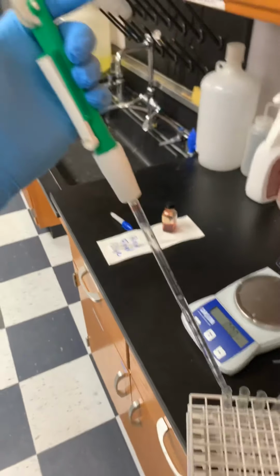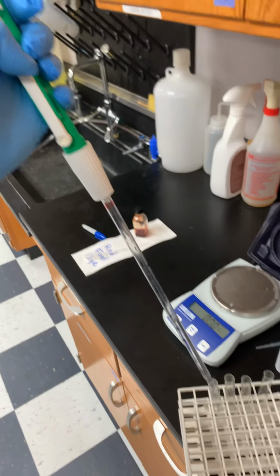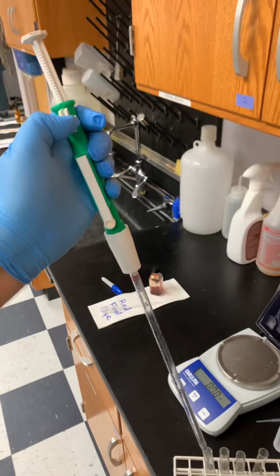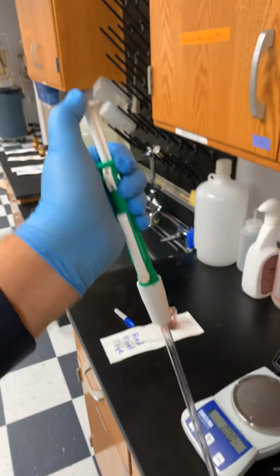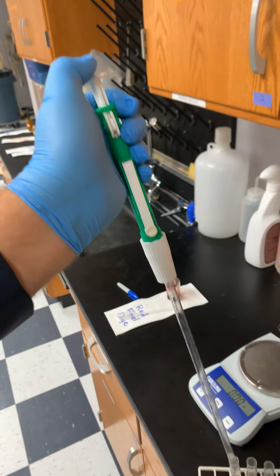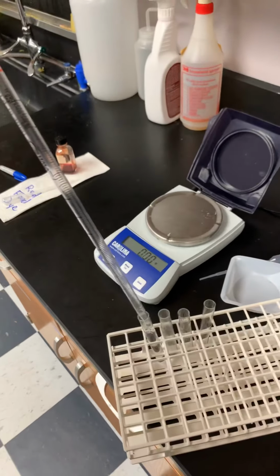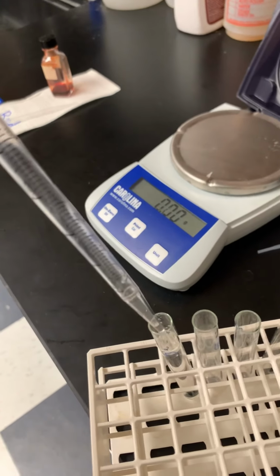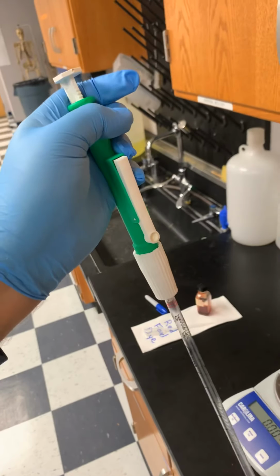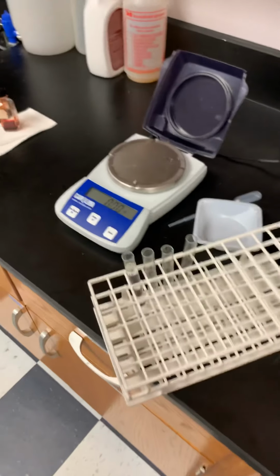And again, I have really 3 different ways I can dispense it. I can press the trigger. If you tap it a little bit, it'll go slowly. Or you can roll it down with this. Or what some people do is they use this up here. I don't like using that as much, but it does work. I like to roll it. If you're using the trigger, it doesn't always get that last little bit out. You know, so there's a tiny little bit of water in there. Just finish rolling it down with this, and it'll get the last of it out. So that was 8 mils of water.